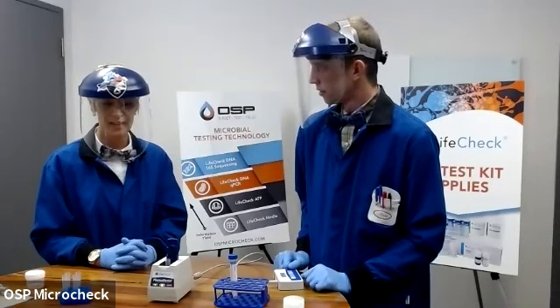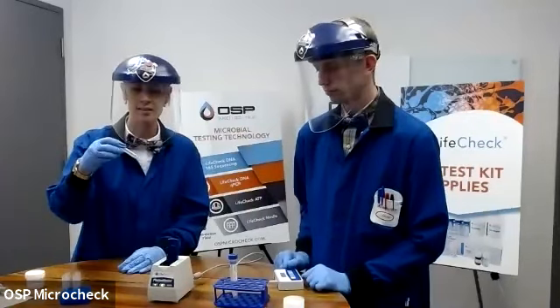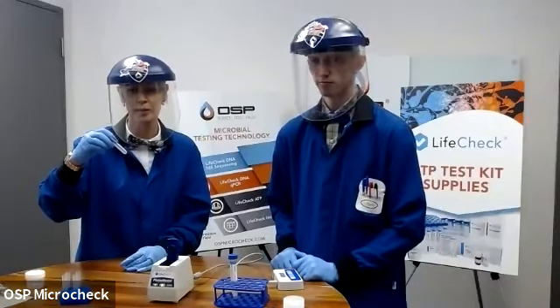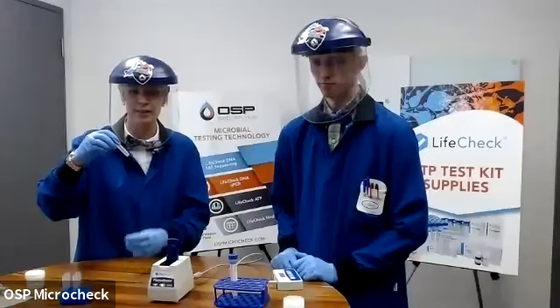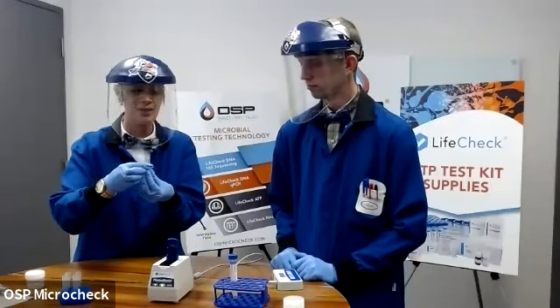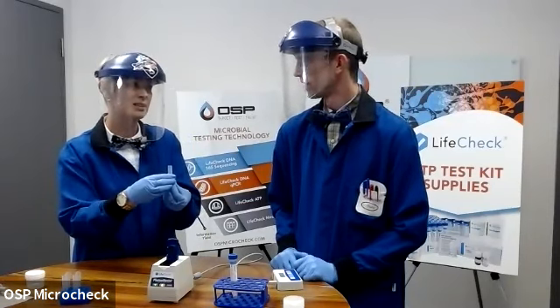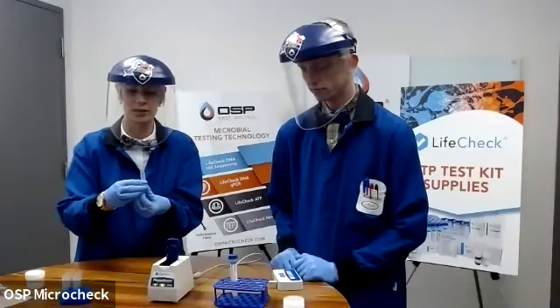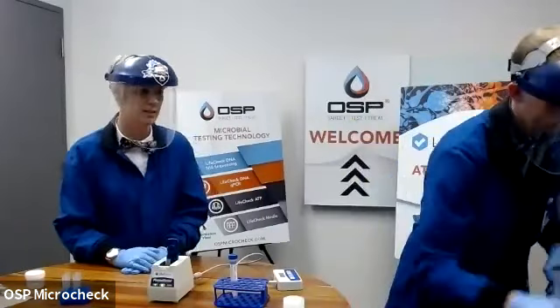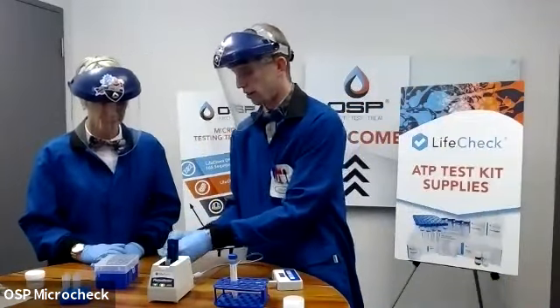The other thing that might happen if you get a very high reading on this is that these are pretty robust, but if they have been banging around or being squished within different equipment and things like that, and they start getting scratched up, they will start giving a higher reading. I'd say it's around 30 RLU that you might toss it and grab another one. Yeah. That's probably the max that you want these to read at. And it is simply just grab a new one and start over with the next. All right, so we are happy with our background reading of 5 RLUs.